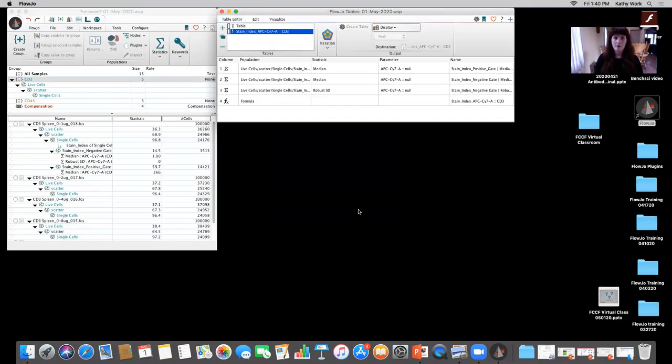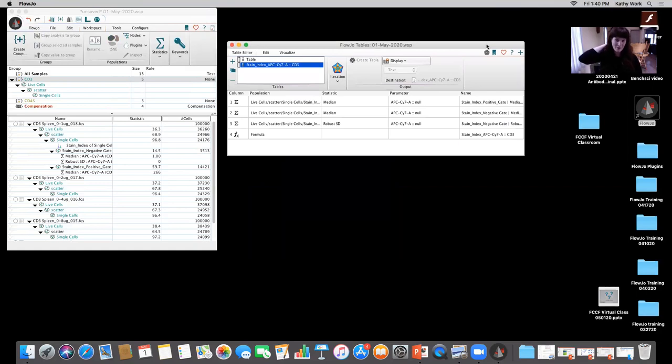I'm going to hit OK. And all of the statistics that I had showed everyone how to do manually, we can now look at how it generates automatically. It's always important that you have an understanding of what you're doing and why you're doing it, which is why we went over it previously.